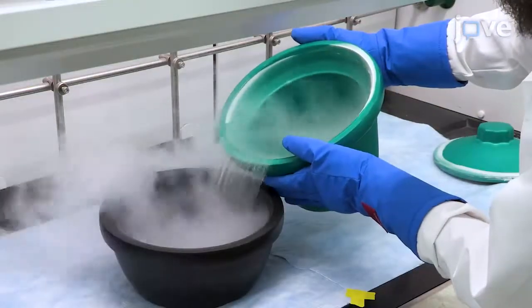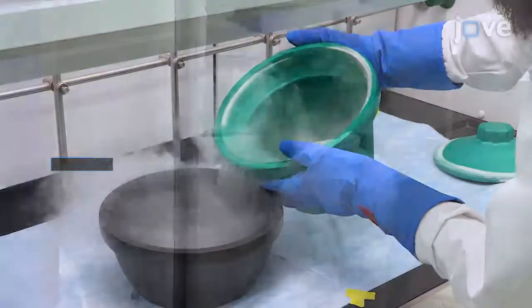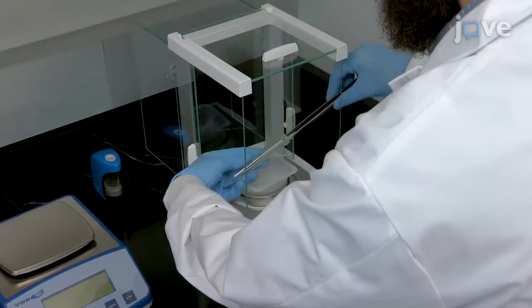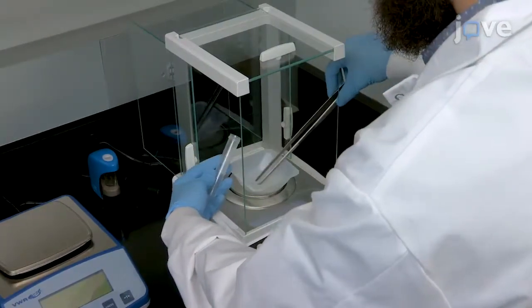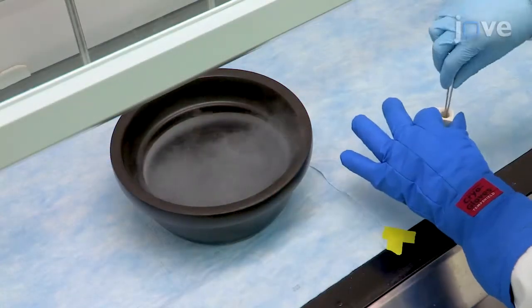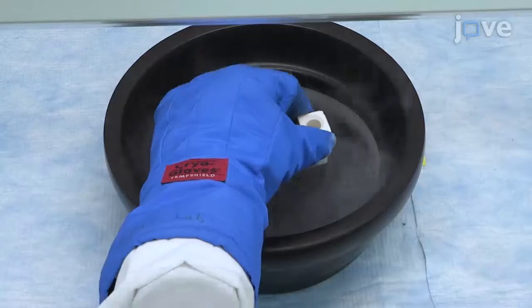First, fill a shallow container with liquid nitrogen. Remove the samples from the freezer and weigh each lyophilized MFP. Place 1 sample in the mortar. Use a cryogenic glove to hold the mortar in the liquid nitrogen.